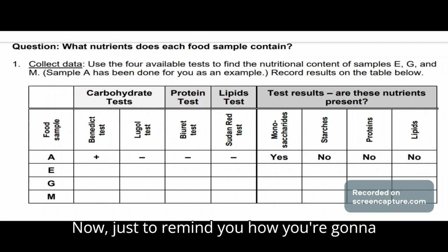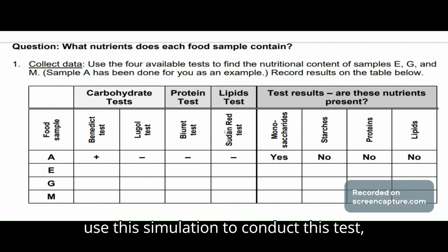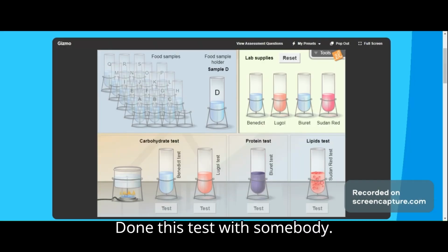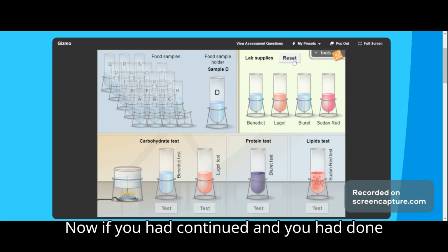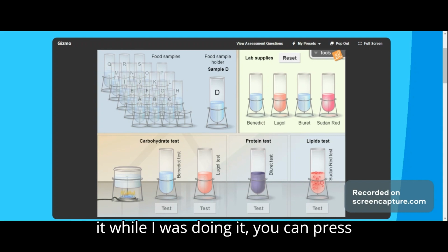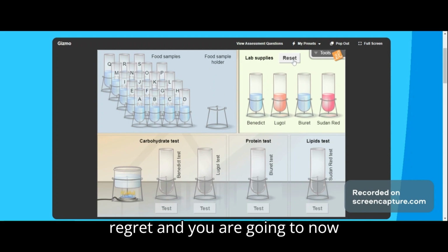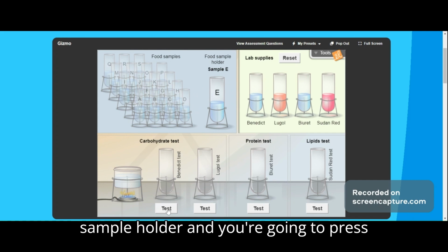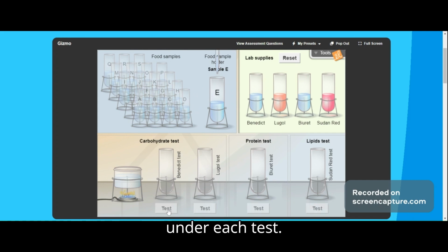Now, just to remind you how you are going to use this simulation to conduct the test, this is what you're going to do. We just did this test with sample D. If you had continued while I was doing it, you can press reset and then search for E, drag it to the food sample holder, and press test under each test.